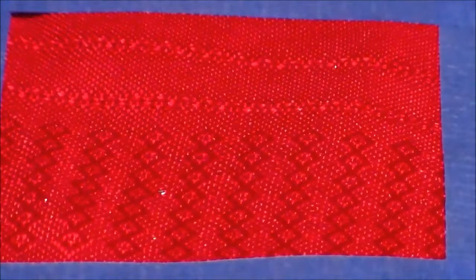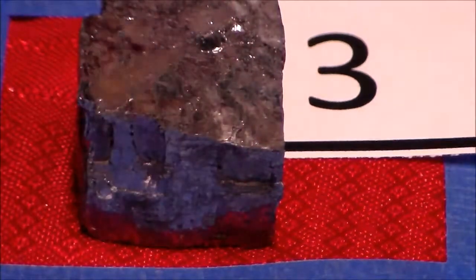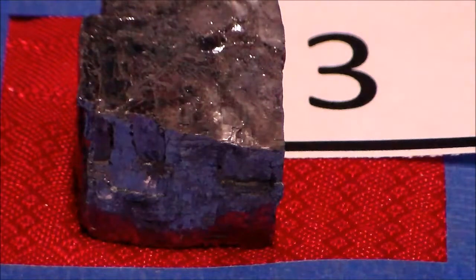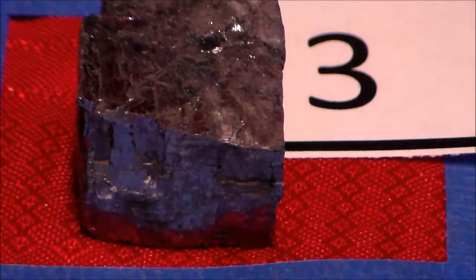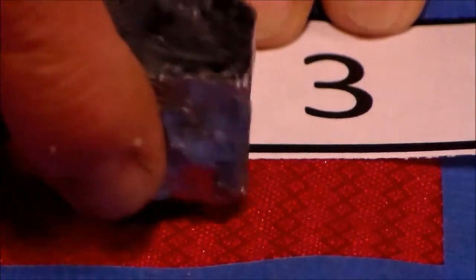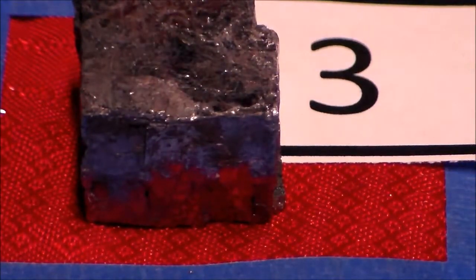Okay, well that only leaves us this last metallic one, which is sample 3. Now sample 3 says it's metallic, which we know it is. It has cleavage that is cubic. Cleavage is when a mineral breaks along a plane of weak bonding. So some minerals break along one plane, some break along 2. They can break at different angles. But this one, if you look at it, it's the shape of a cube. So it has our cubic cleavage.